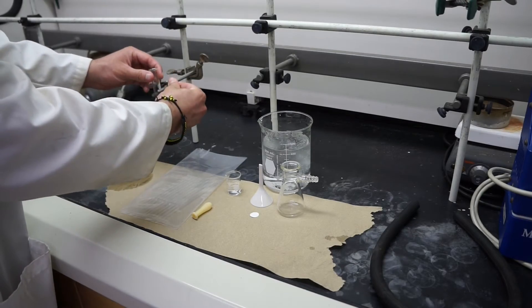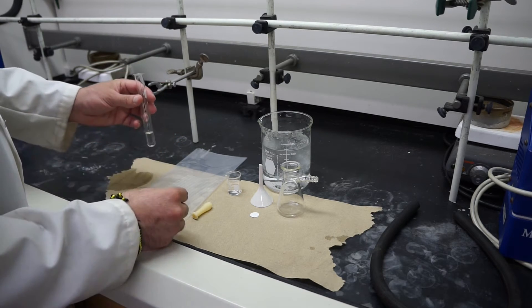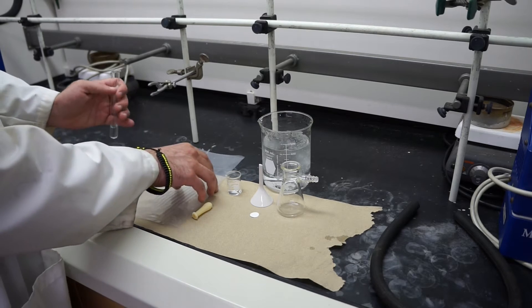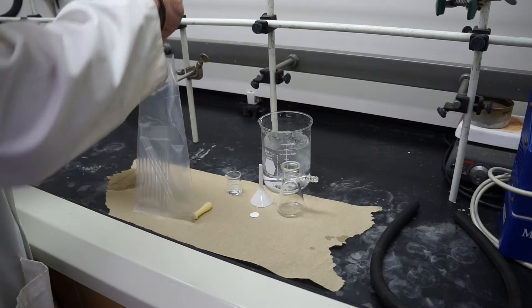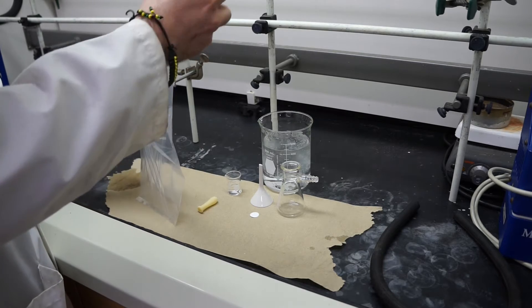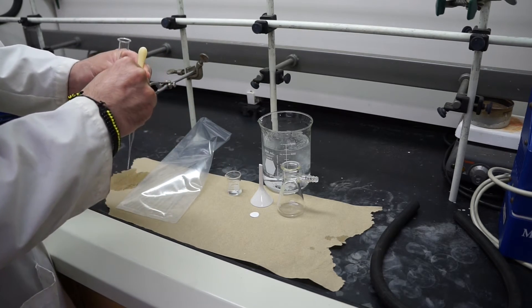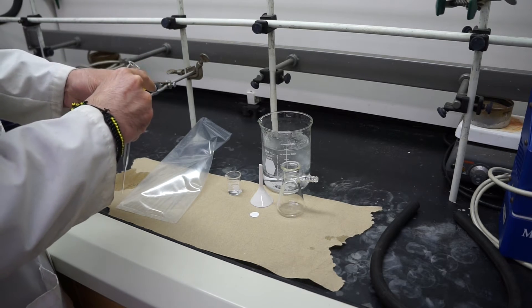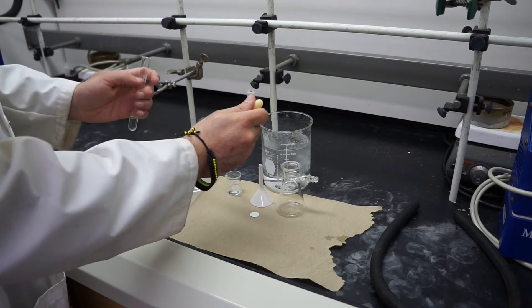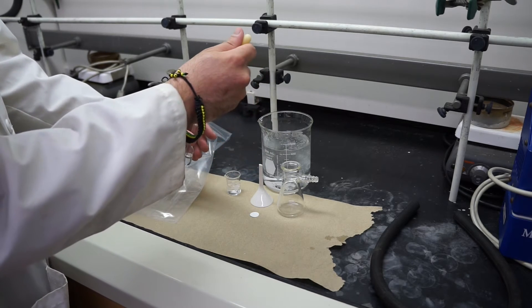Okay, so once you have your reaction going and it's sat for at least 10 minutes you're going to add a little bit of solvent. So it says 2 milliliters. You don't have to be exact with 2 milliliters, it's more of a roundabout gesture. I'm going to get one of these pipettes and take some of our solvent. We'll say this is cold water here and then we'll do about 2 milliliters.